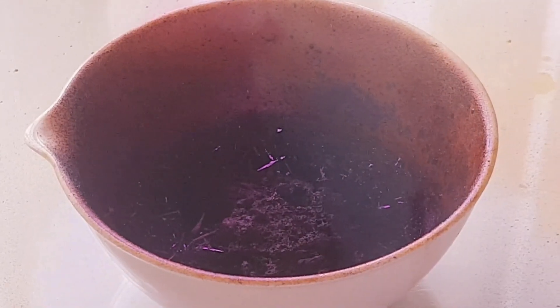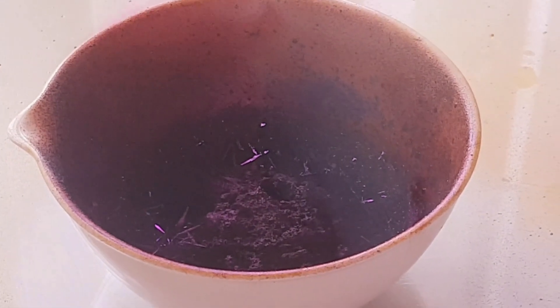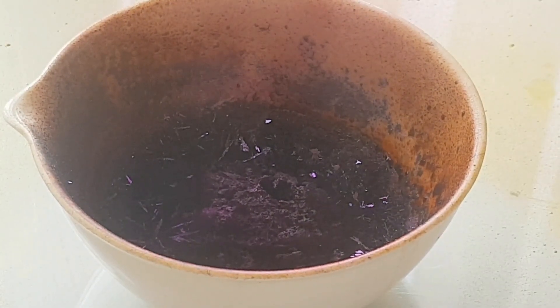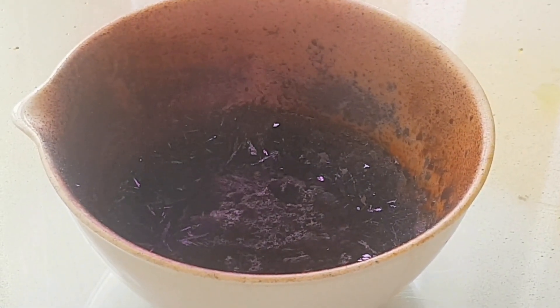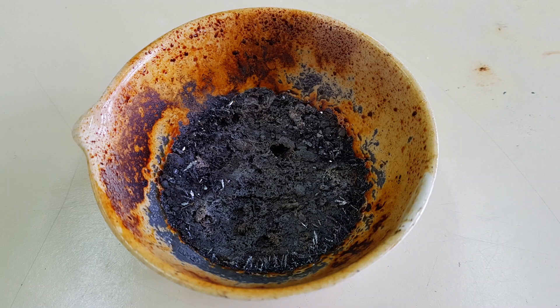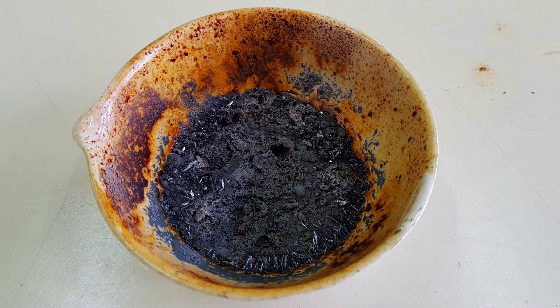The reaction is slow and lasts several minutes. Eventually, crystals of zinc iodide form.